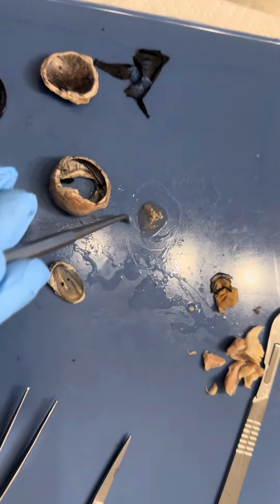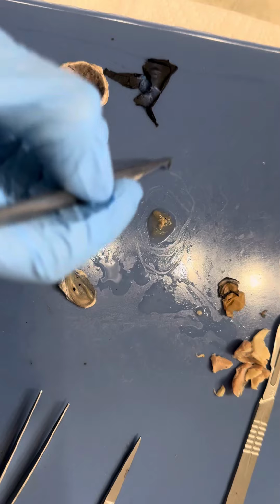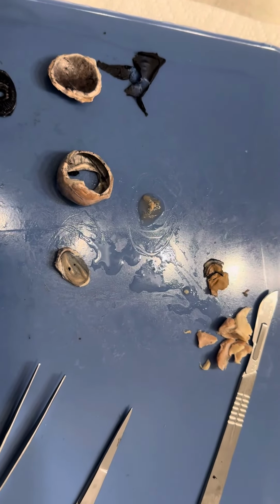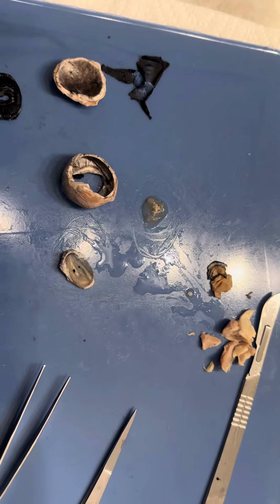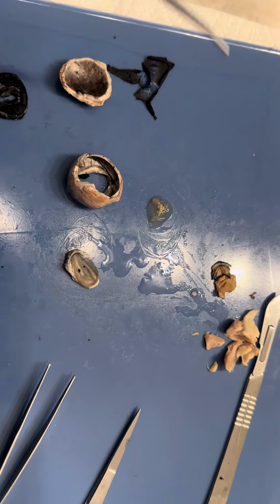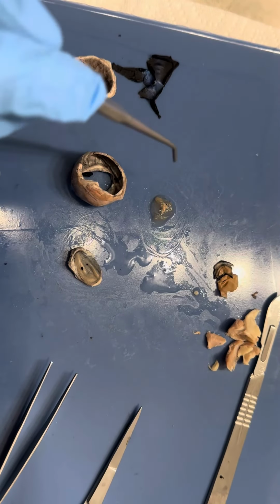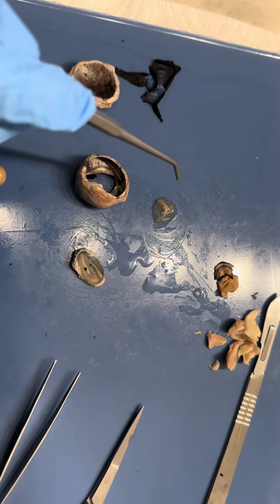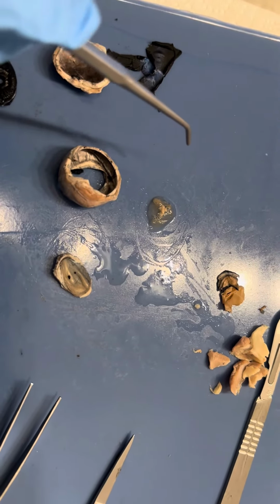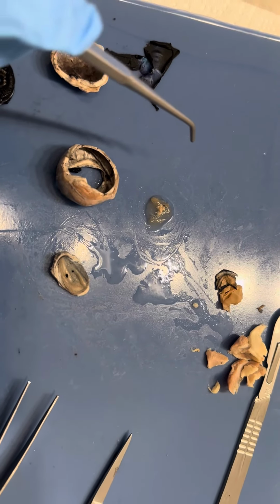Our retina is over here. So the retina is a very thin layer inside the eye. It's the last layer, or the first layer, I could say, from the inside of the eye, and then we have our choroid and the sclera. So the retina is composed of receptor cells, which we talked about just a moment ago, called cones and rods. Cones perceive color, while rods perceive light intensity.